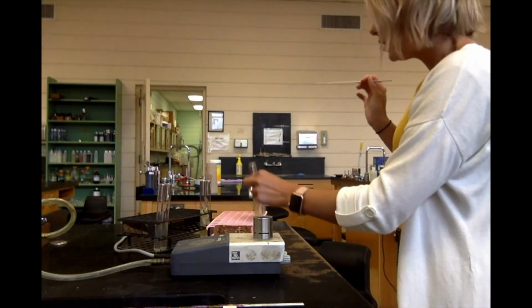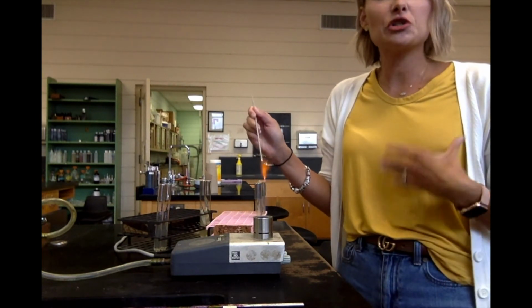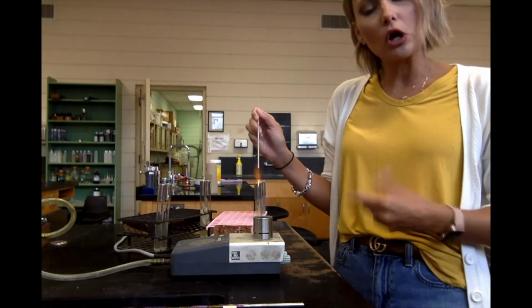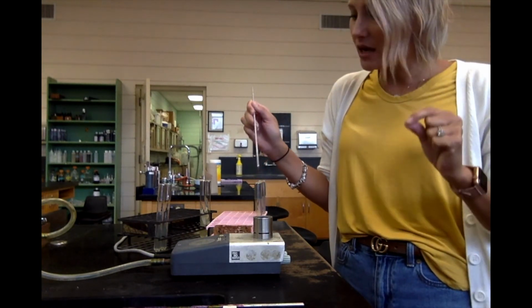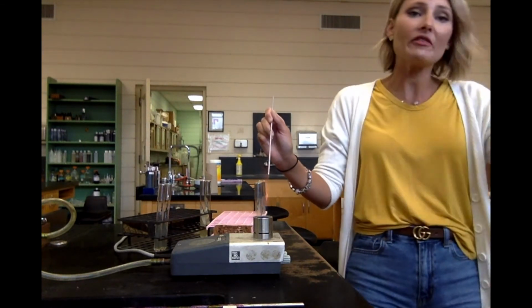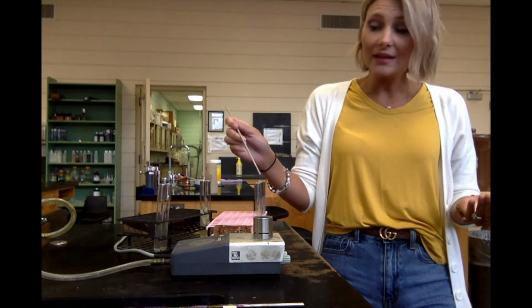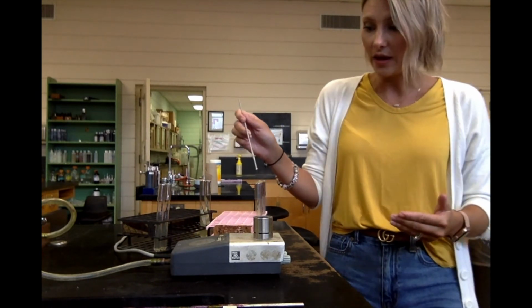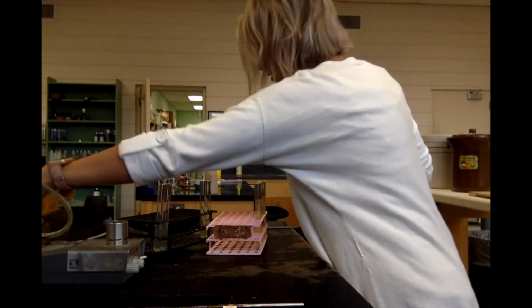Now, it's important that when you're doing this that you get your stab line as straight as possible, and you want to go down all the way to the bottom and come all the way back up. Because we're wanting to see where the bacteria grows. Does it grow all the way at the bottom where there's no oxygen? The only way you're going to be able to see that is if you put the bacteria down there. Okay? So, now let's read our results because I have some that are ready to read.